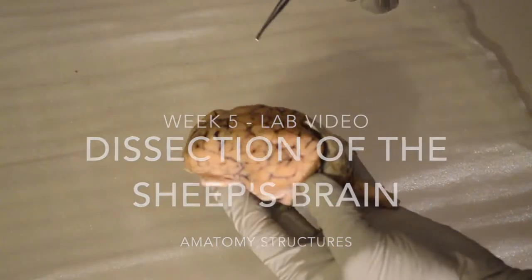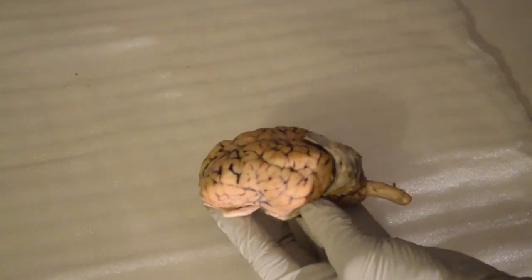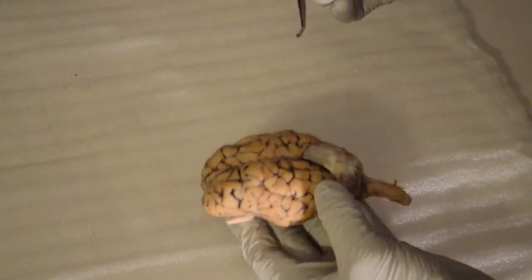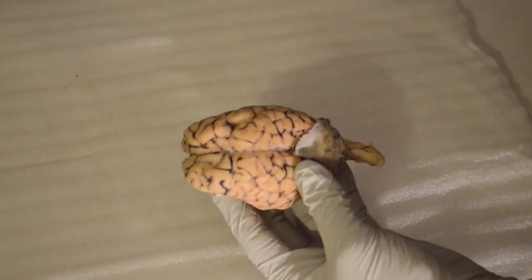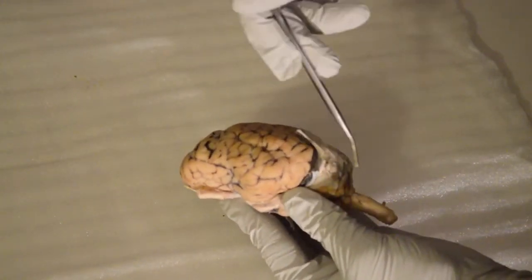Just want to give you a quick shout out to the dissection of the sheep's brain. We're going to start off with the exterior and then go into the interior structures of the brain and some of the functions that go along with it. Here we have four regions of the brain: the frontal, the parietal, the temporal, and the occipital.